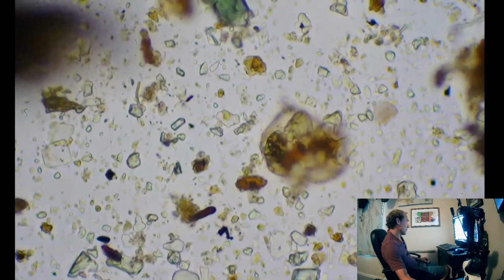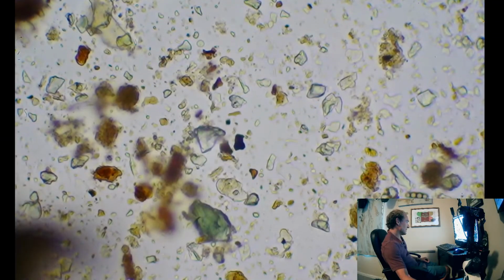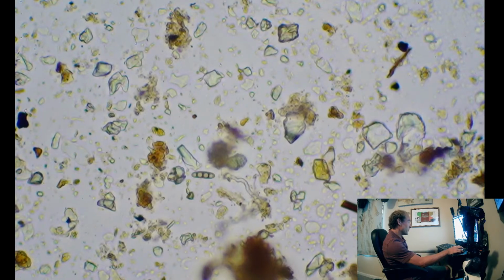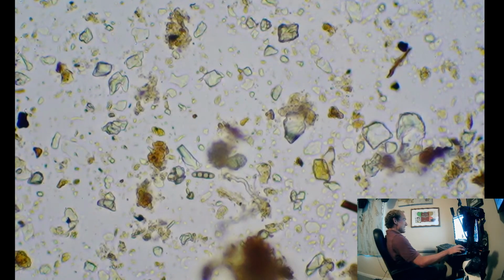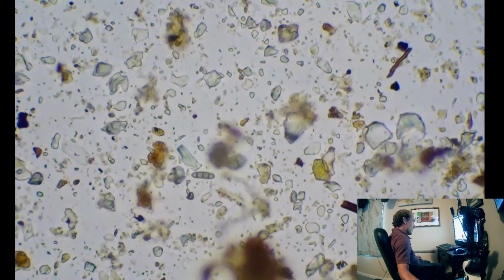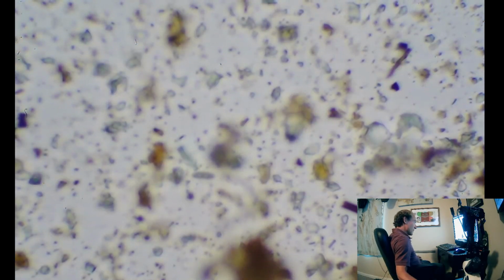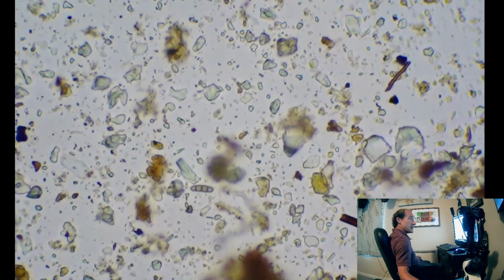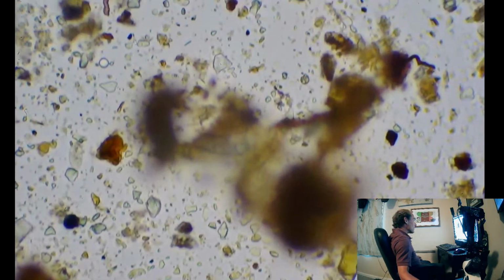That they were brought quite a ways away from where I bought the seeds. We got a fungal spore right there. I mean, there's fungi in there, but it's not where we want it to be, or evidently it's not where it needs to be to outcompete.